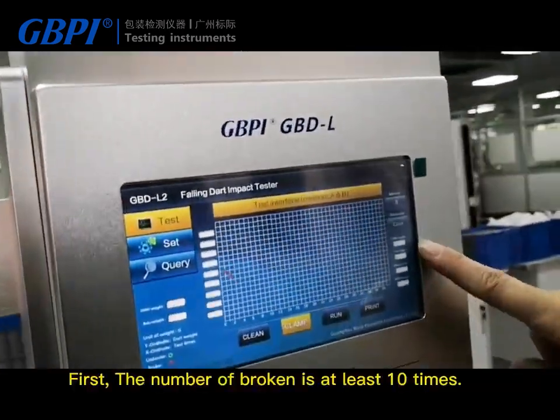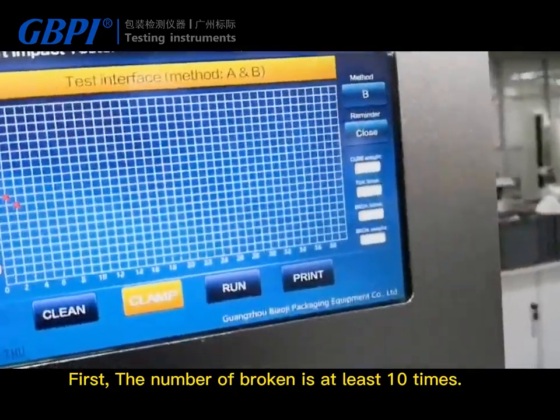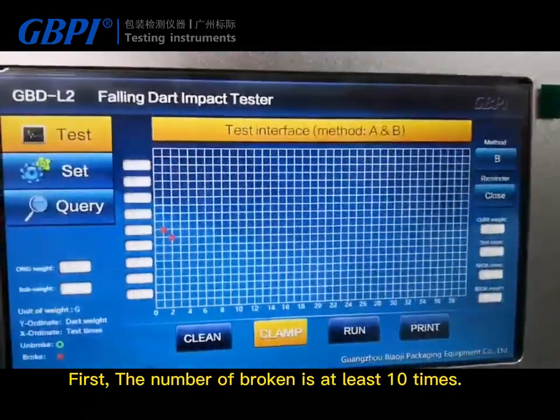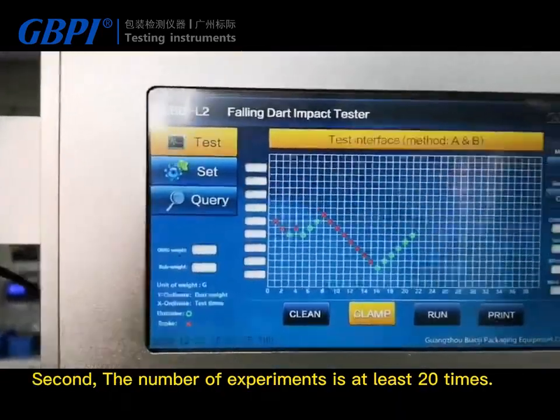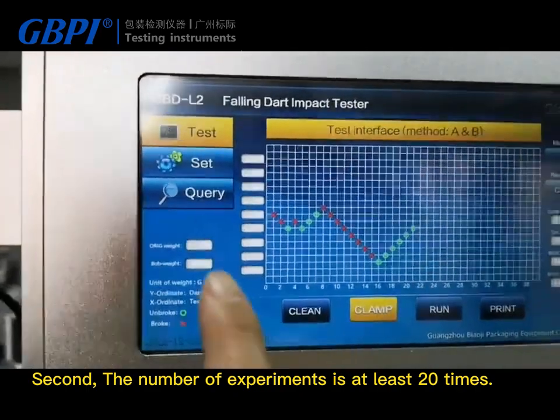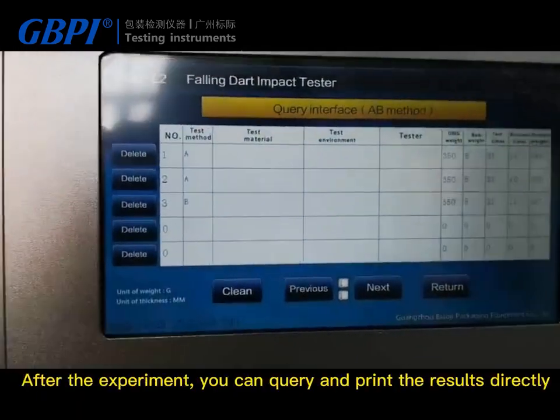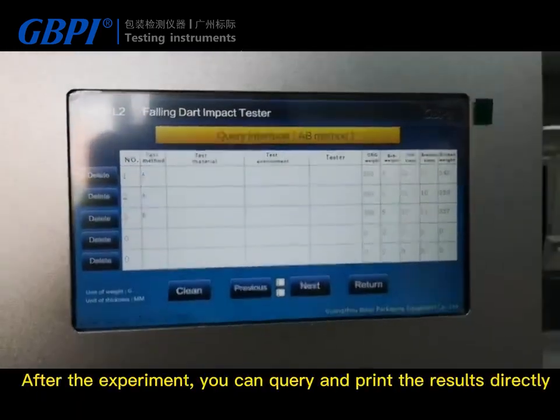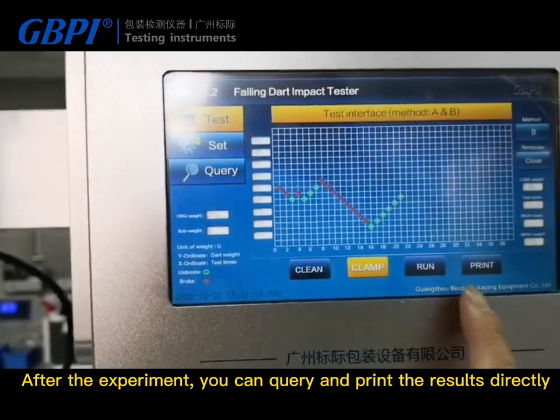Methods A and B need to meet two conditions at the same time: first, the number of breaks must be at least 10 times; second, the number of experiments must be at least 20 times. After the experiment, you can query and print the results directly.